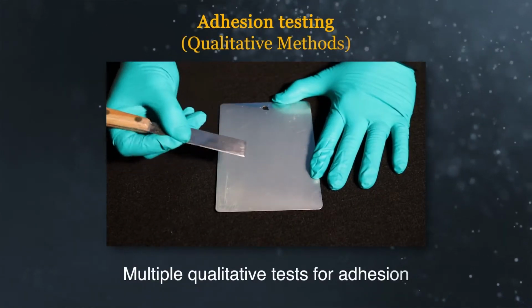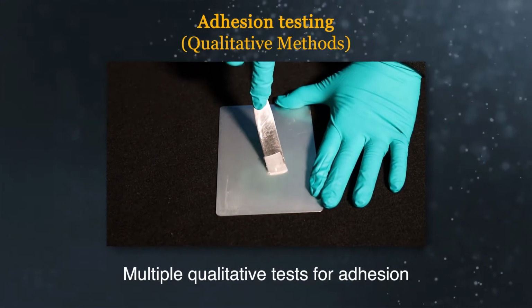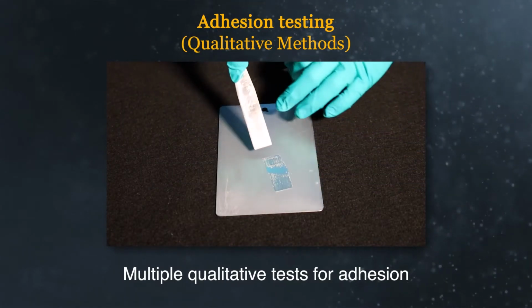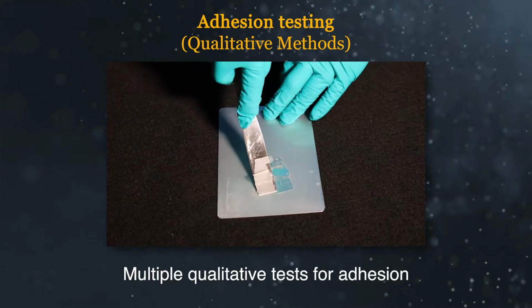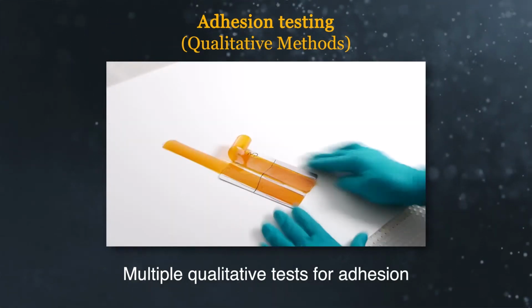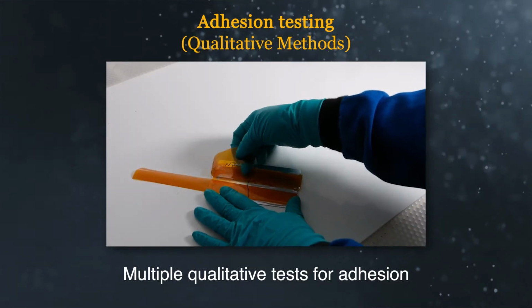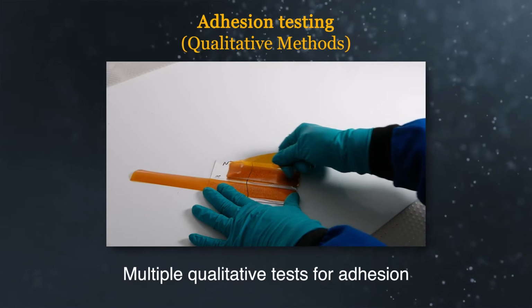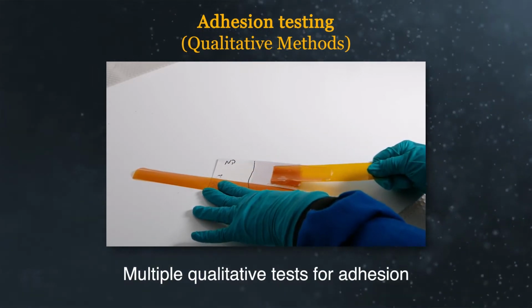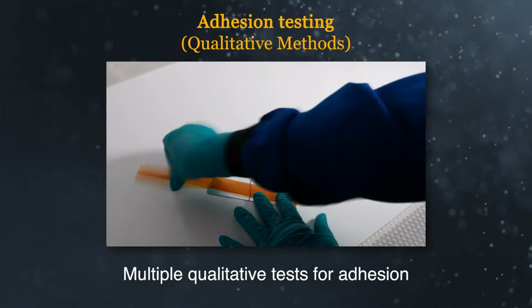There are many customer-based tests to quickly evaluate a material's adhesive performance. For example, conformal coatings may be evaluated by trying to scratch the coating off, but that may be measuring tear strength or toughness instead of adhesion. Another example is a customer peeling off an adhesive by hand. These examples are useful for getting a quick estimate of adhesion quality, but both are qualitative, making it difficult to compare performance between products on devices.